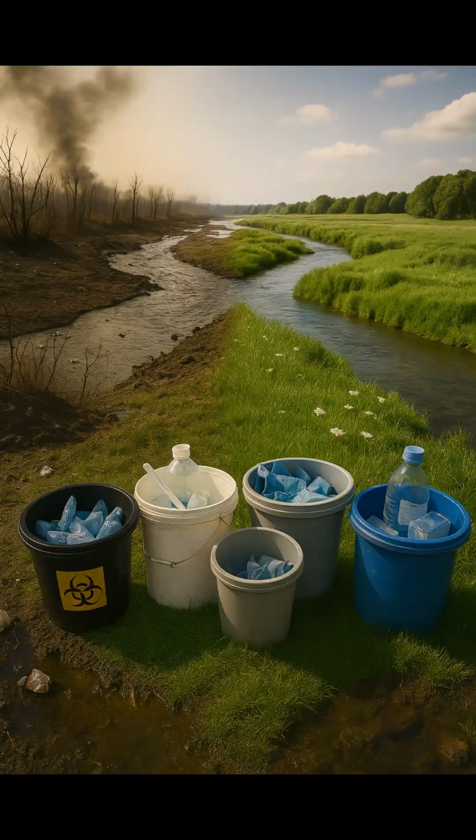To help you navigate this video, we've added time tags in the video description. You can use them to jump straight to the waste category you're looking for. Proper waste separation is not just about keeping the lab tidy. It's also crucial for safety, sustainability, and compliance with disposal regulations. So let's go through each material type one by one.